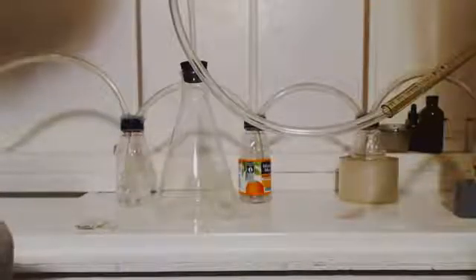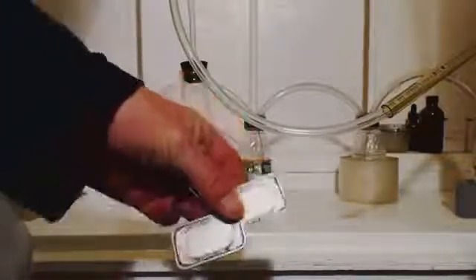All right, this is John Black, super chemist. We're here to make some silver nitrate. Here's my apparatus. First of all, I got two bars of silver and I got my Erlenmeyer flask here.